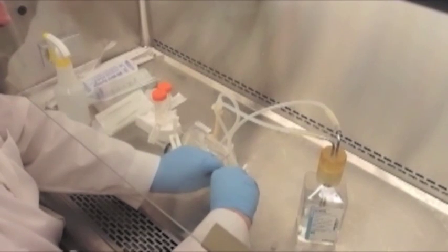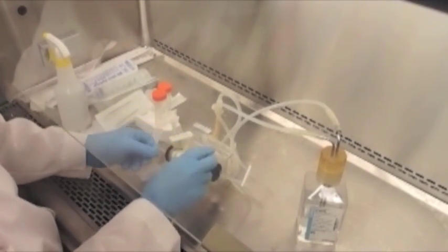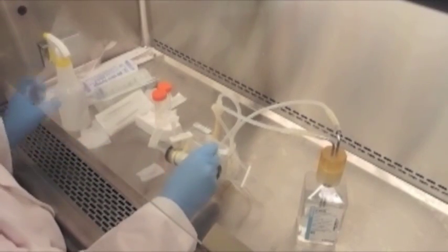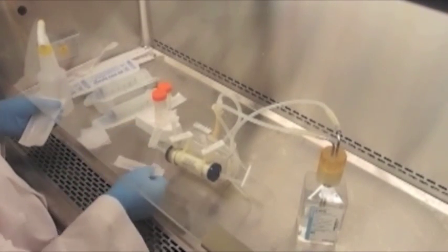Whenever we take luer fittings off of the side ports, we want to be sure that the slide clamps on the side ports are also closed in case there's any pressure inside the extracapillary space and media will come out onto the luer fittings. This is a potential source for contamination.